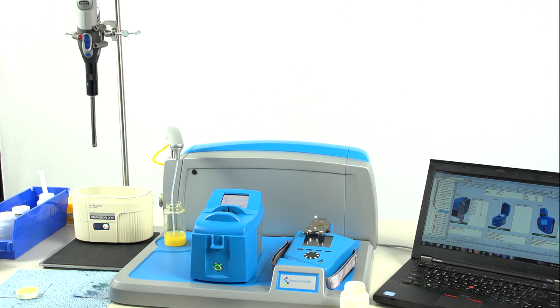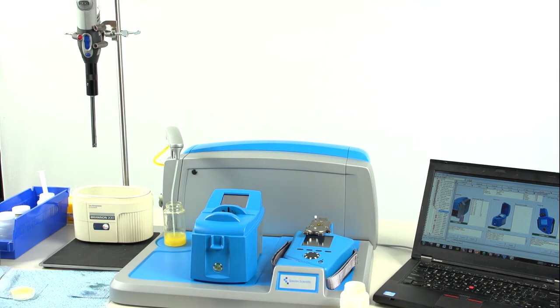After the ultrasonic, which removes the air bubbles, we process the sample on the particle count and ferrous monitor. This test measures particle count and ferrous wear on the LNF Q230.